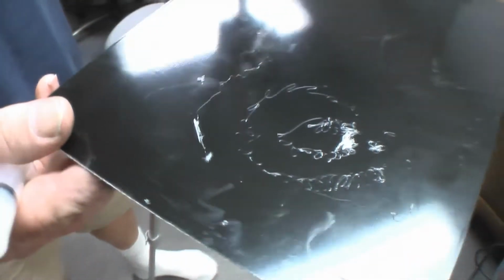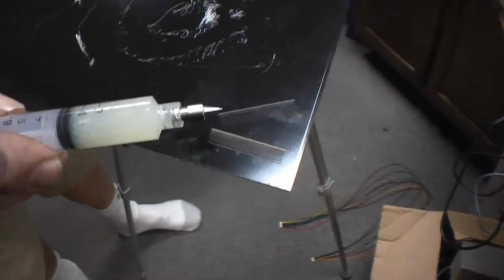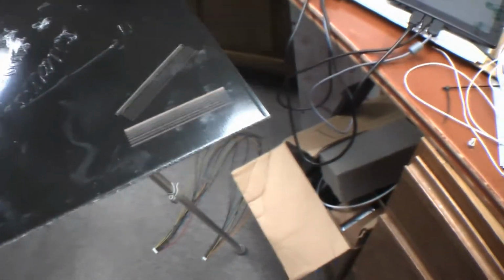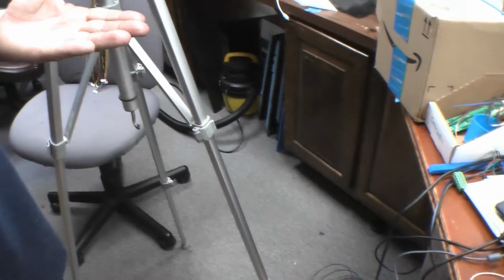Okay, and so while you're there, you'll see there's a pattern right here in the corner. I drew this with a laser, and it goes to ever smaller increments. So it starts off at 1 millimeter and moves down to 100 microns spacing. And so, actually 10 micron spacing, which is why the last little bit looks like a solid line. It's thinner between the lines than the actual width of the laser. Right. All right, and we're going to do the same thing with this and see what it looks like. All right, so there you go, and wow, let's load it up.